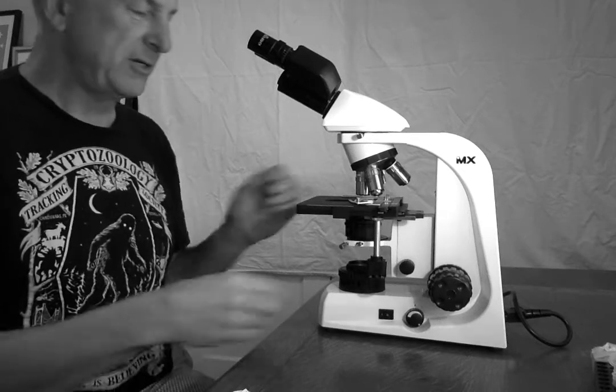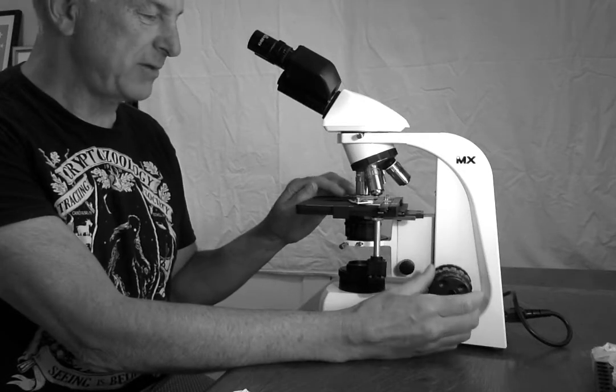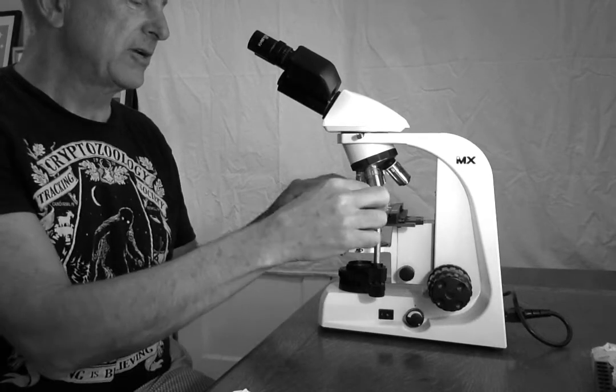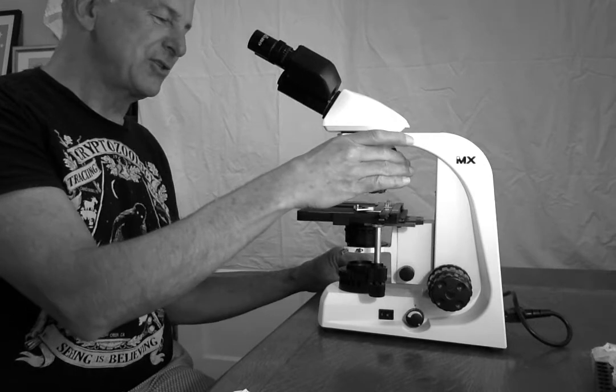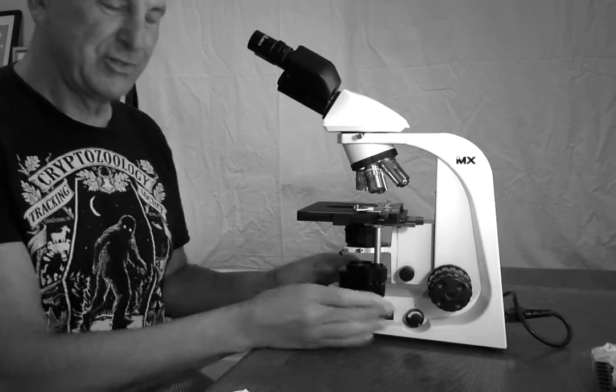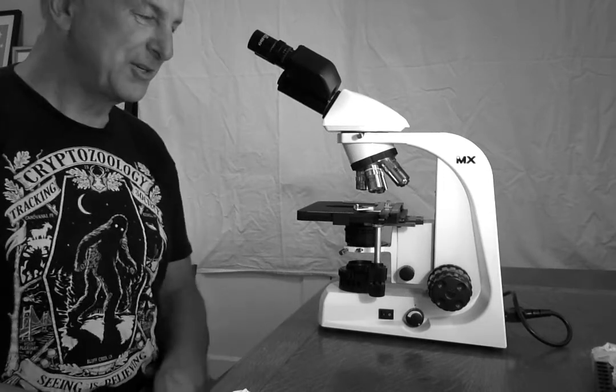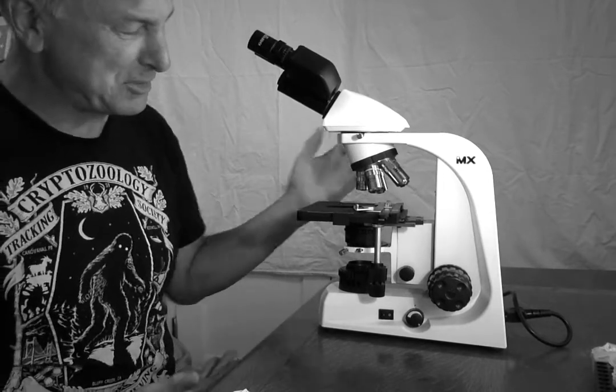Hi, this is my brief introduction to working with the Meiji microscopes. I'm going to start by going through some never do's, some must do's, some always do's, some red flag warnings that if you don't follow these, you could get in trouble and be banned from using these microscopes.